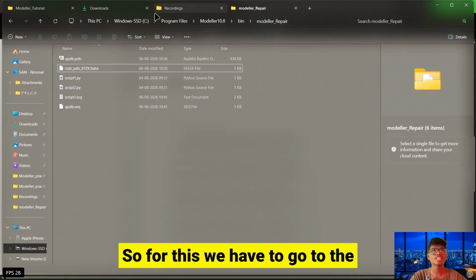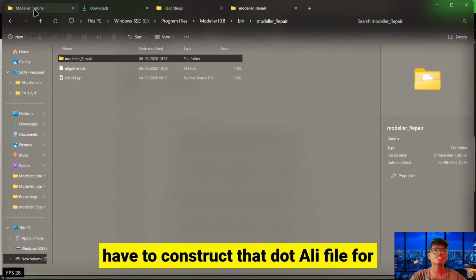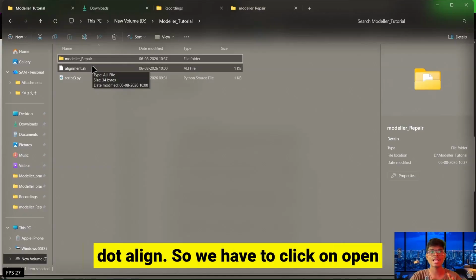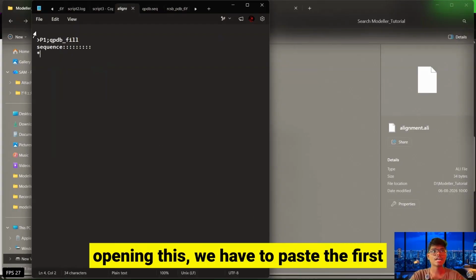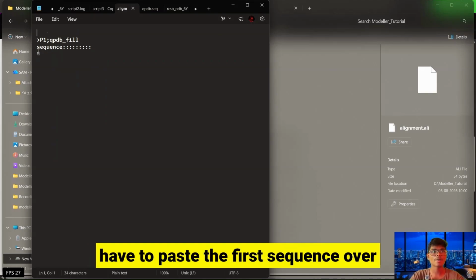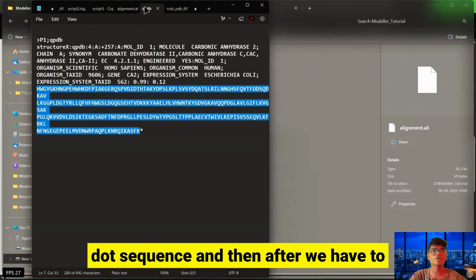For this, we have to go to the modeller repair folder, and you have to construct the .ali file. For that, I have a file named alignment.ali. So we have to click on open using Notepad. After opening this, we have to paste the first .seq file over here, and then we have to paste the FASTA sequence over here. So we first load the qpdb sequence, and then we copy the whole content.